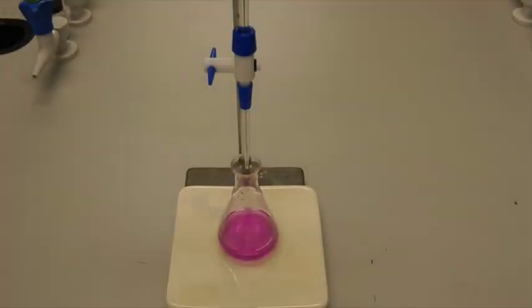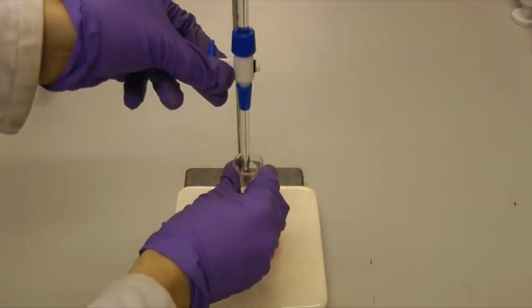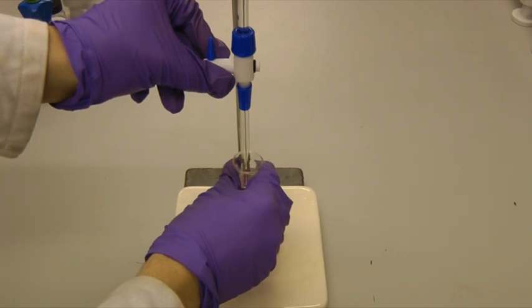If you're right-handed, turn the tap with your left hand and swirl the conical flask with your right hand until you reach the end point.